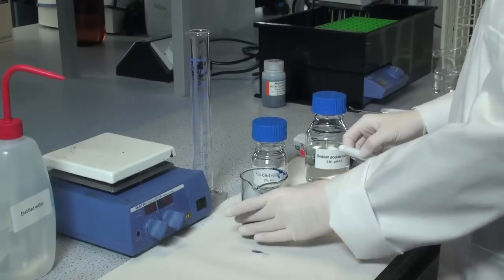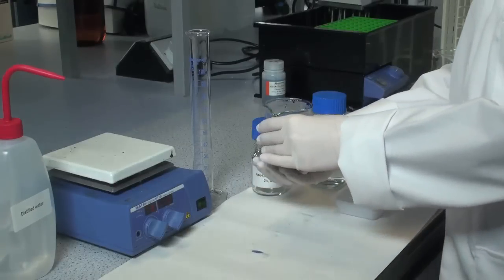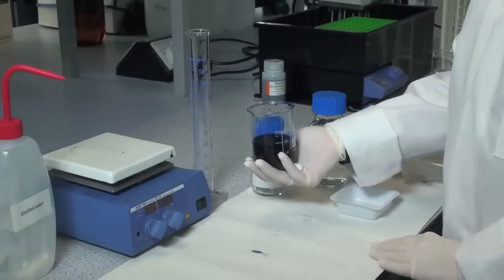If necessary, adjust the pH to 4.5 using a pH meter, but this shouldn't be necessary.